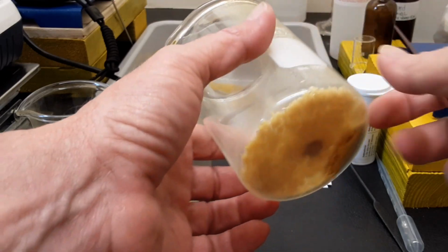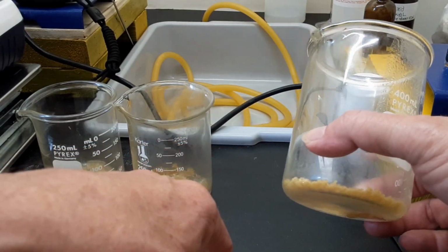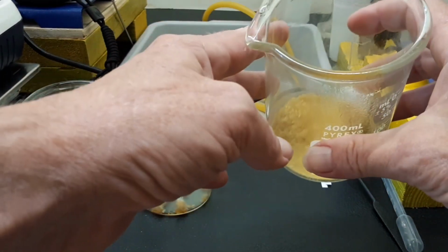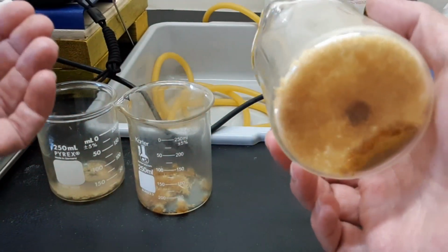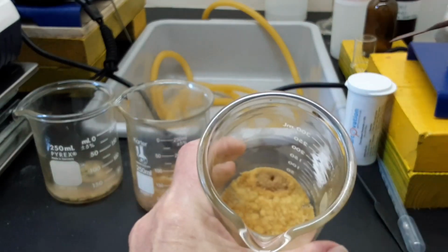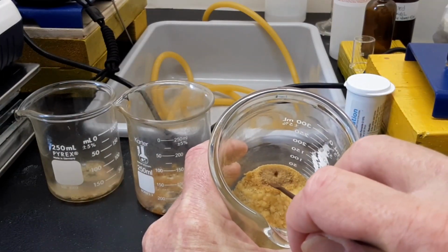It wouldn't even stick to the fritted glass. I mean, once it rolled out of the funnel filter, that funnel filter was so white it looked like you never even used it, because it was so oily. And I thought, well, hell, I'm done for on this experiment. But that's what I got. So anyway, this clump here was not like this basically an hour and a half ago.